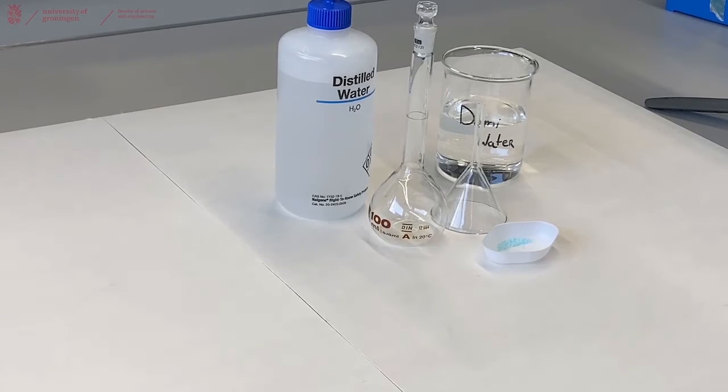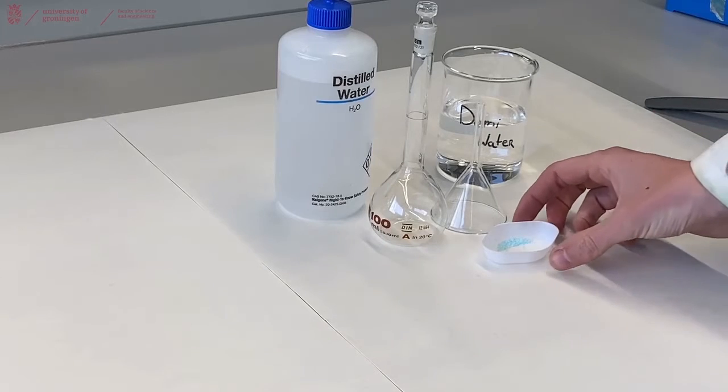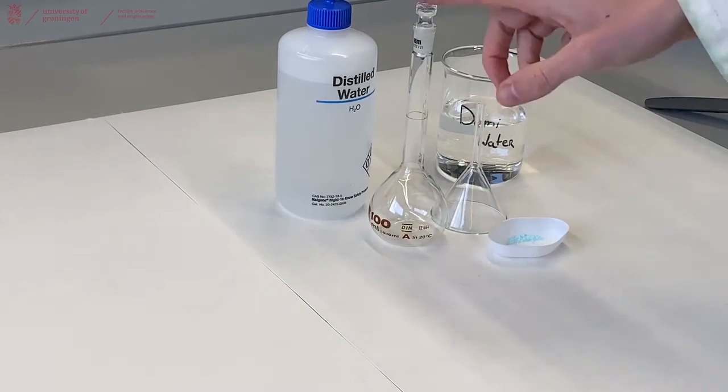To make sure that the concentration is as exact as possible, you have to make sure that everything that you weigh out is transferred into the volumetric flask.